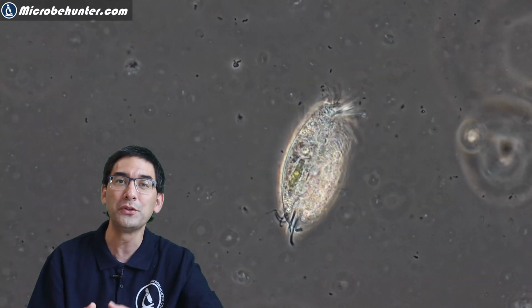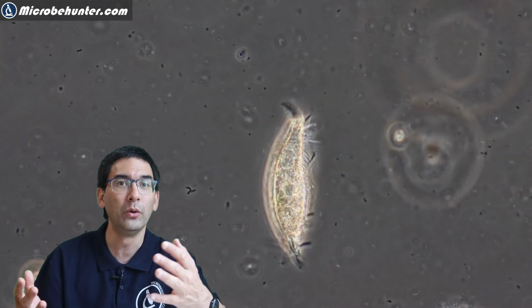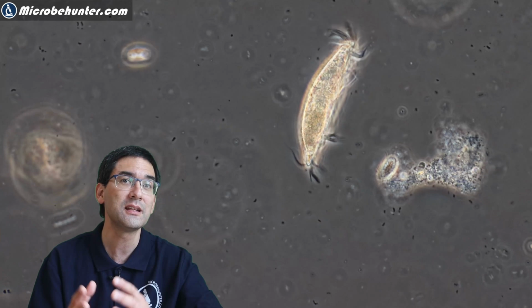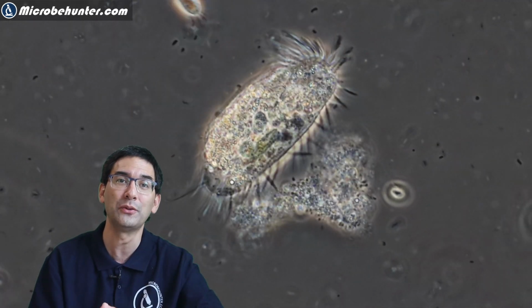I was observing Euplotes for a few minutes, and then I saw that it actually slowed down quite a bit, and its cilia, the little hairs, also stopped moving. And then the whole cell started to simply drift around, not actively moving anymore. A few minutes later, I could see that the cell popped open and the cell contents spilled out into the surrounding medium.